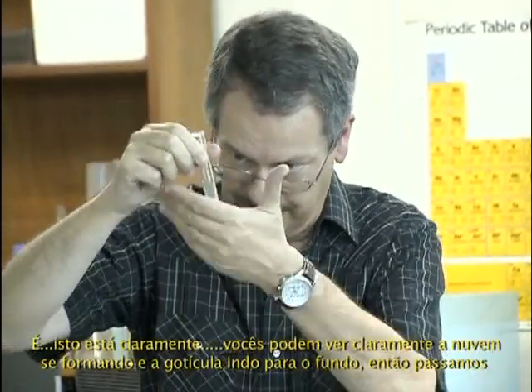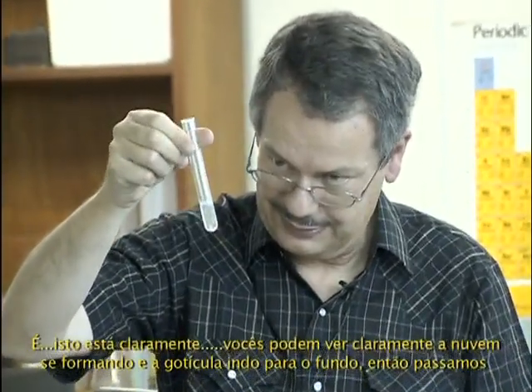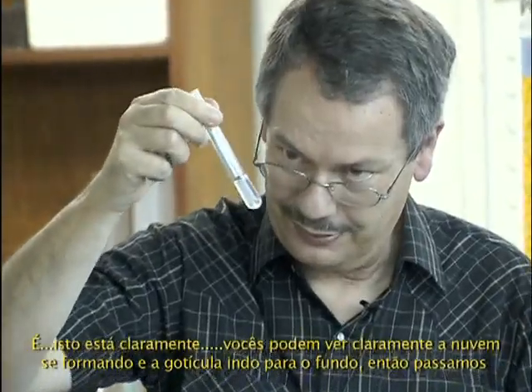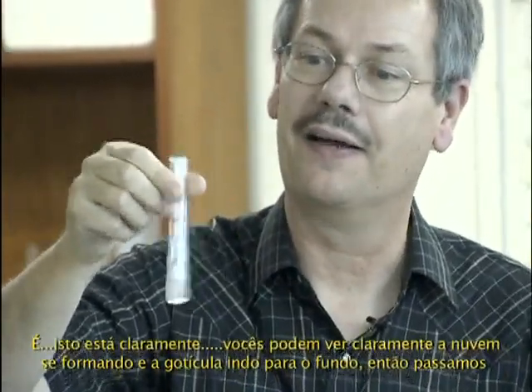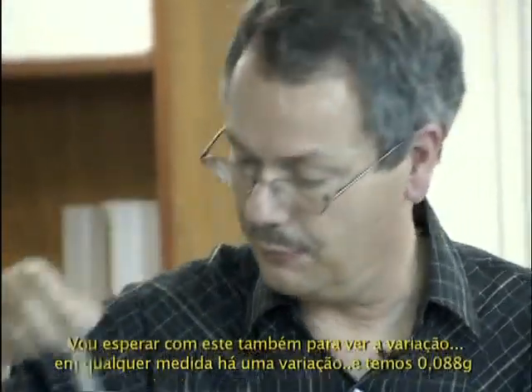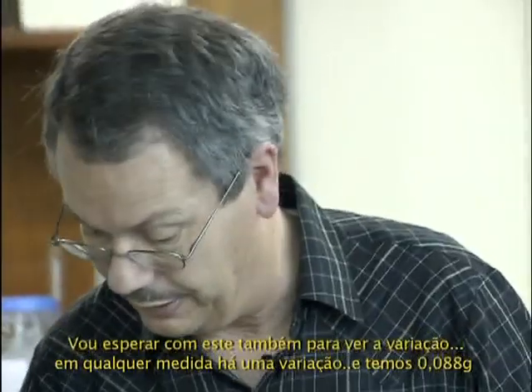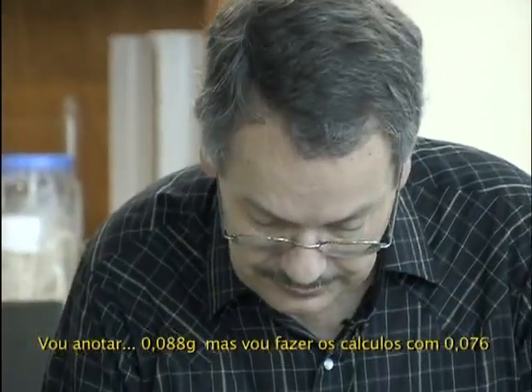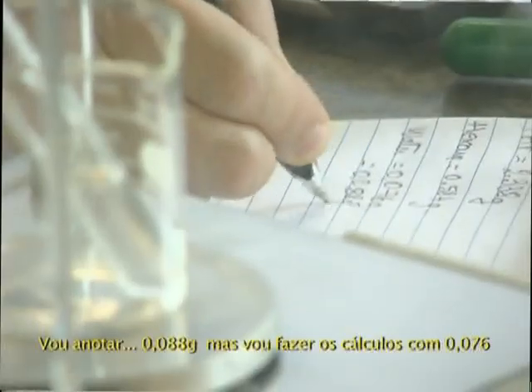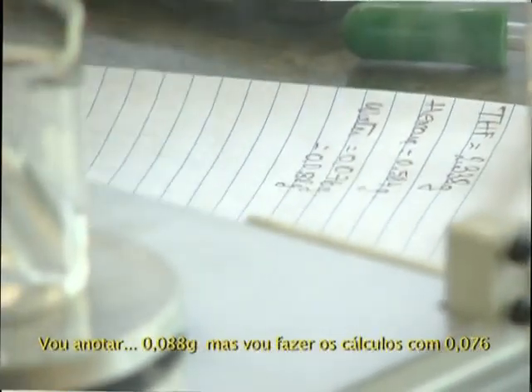Yeah, this is clearly making, you can see the cloud forming, and the little drop goes down. So this is passed. I'll wait this one also to see the variation. Any measurement, you have a variation. And this is 0.088. I write it down also, 0.088 gram. But I will do calculation with 0.076.